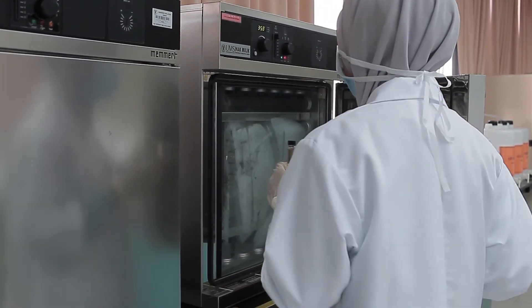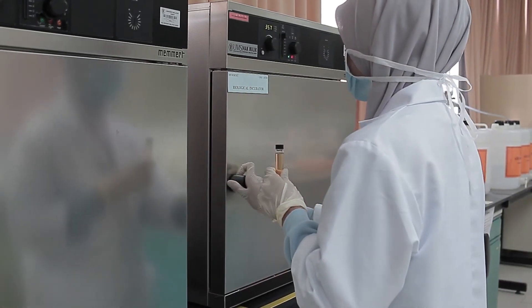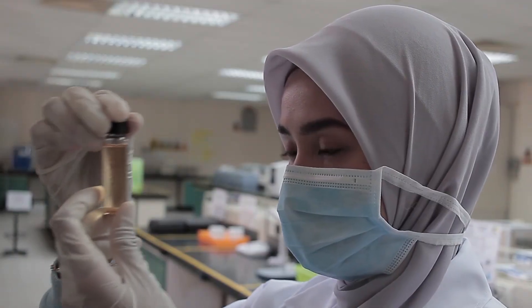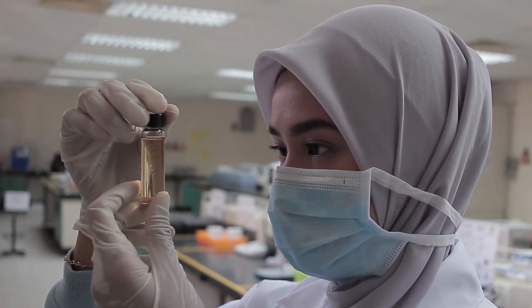After 24 hours, invert the tube to remove air from the inner vial. If the broth is cloudy, coliform bacteria are likely in the sample.